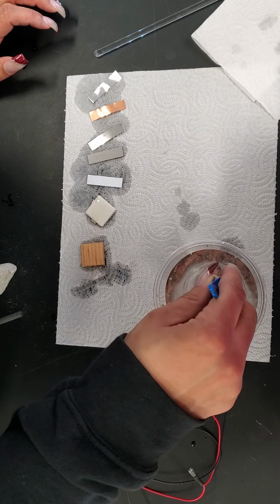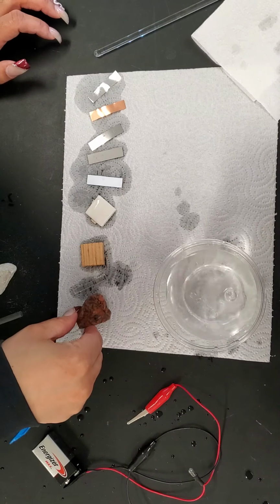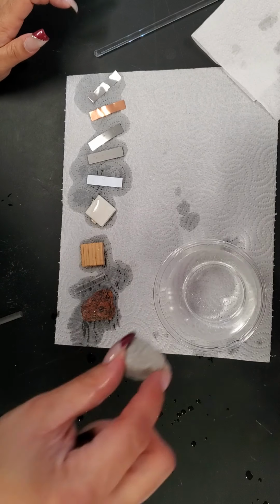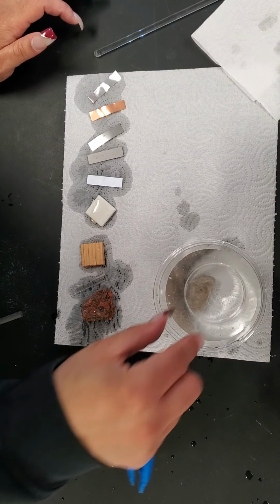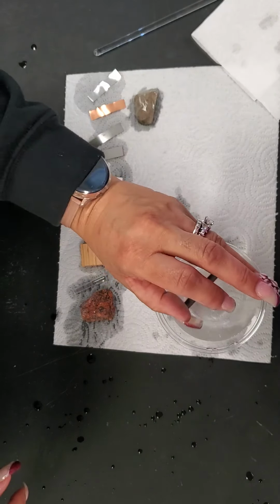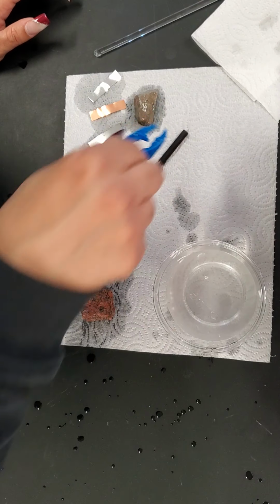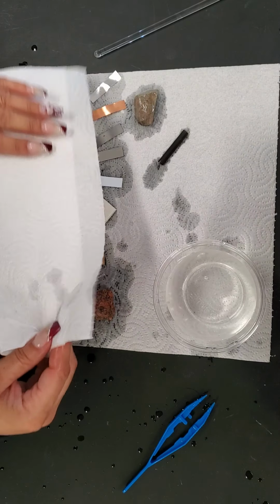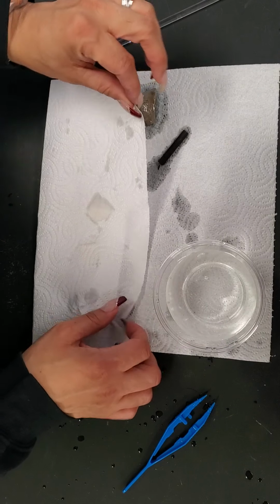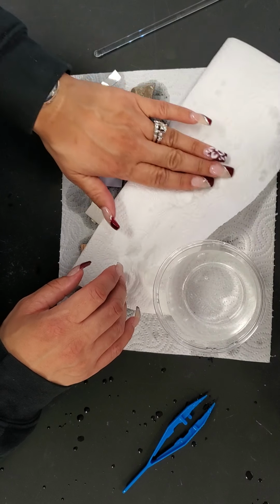The granite sinks. That I'm going to have to use my fingers. And maybe I should move the battery. The limestone sinks. And the carbon rod sinks. Okay, so far everything is more dense than water, with the exception of the wood that is less dense than water.